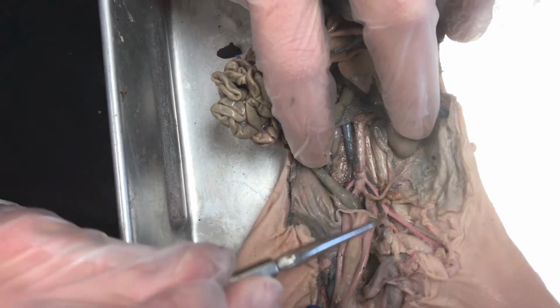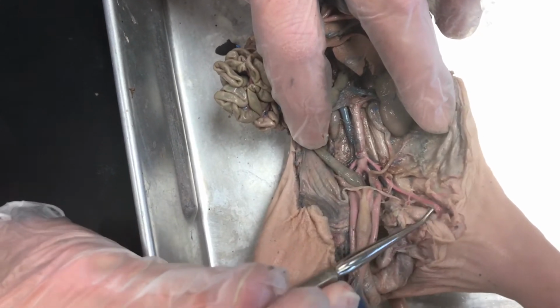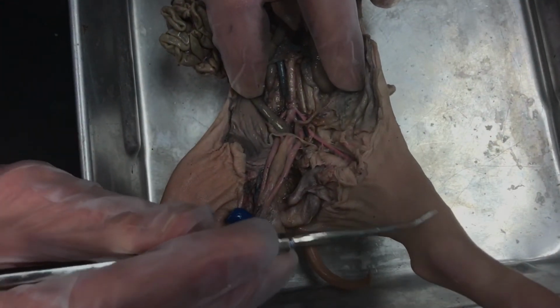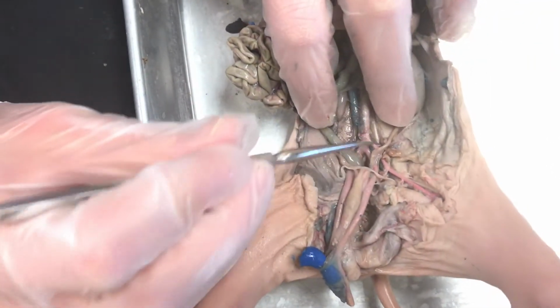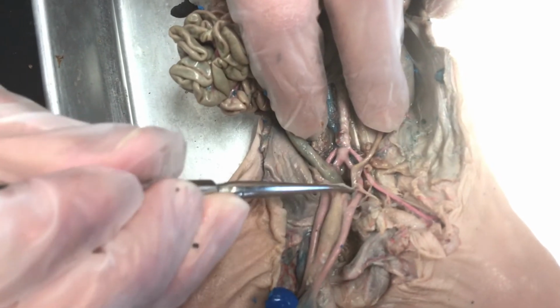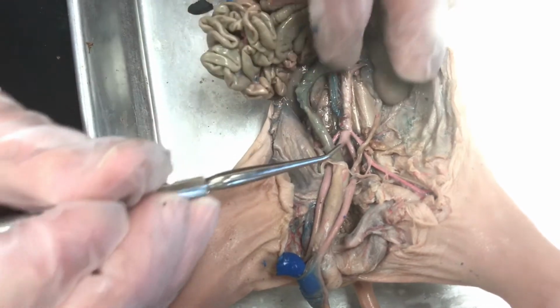And then the iliac artery, as you can see, continues on and becomes the femoral artery down here, and then it's not exposed, but eventually it gives rise to the posterior and anterior tibial that we learned about, but won't be on this particular assessment. You might wonder about these internal branches. These internal branches, as you can see, are going into the umbilical cord. So these outer ones, though, are the iliac.